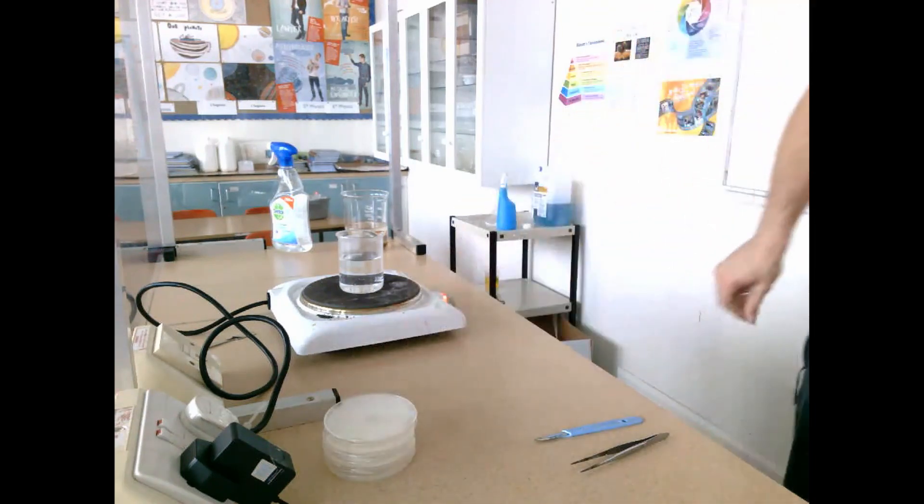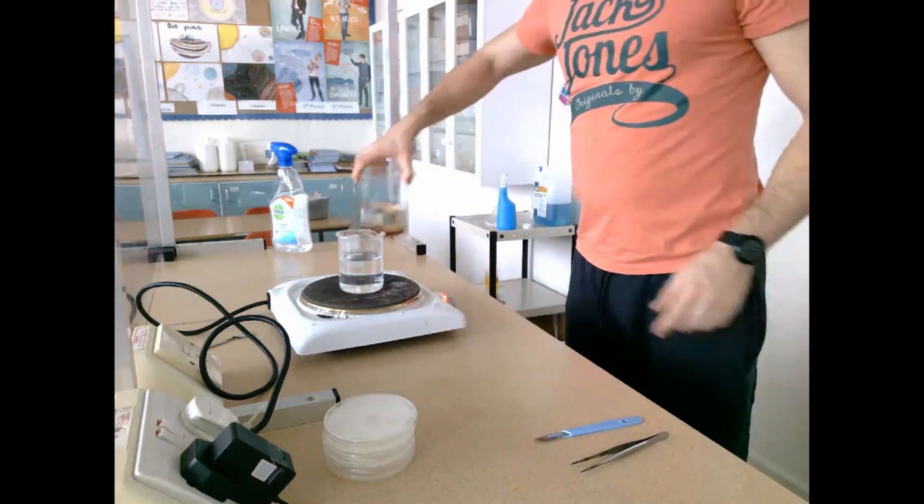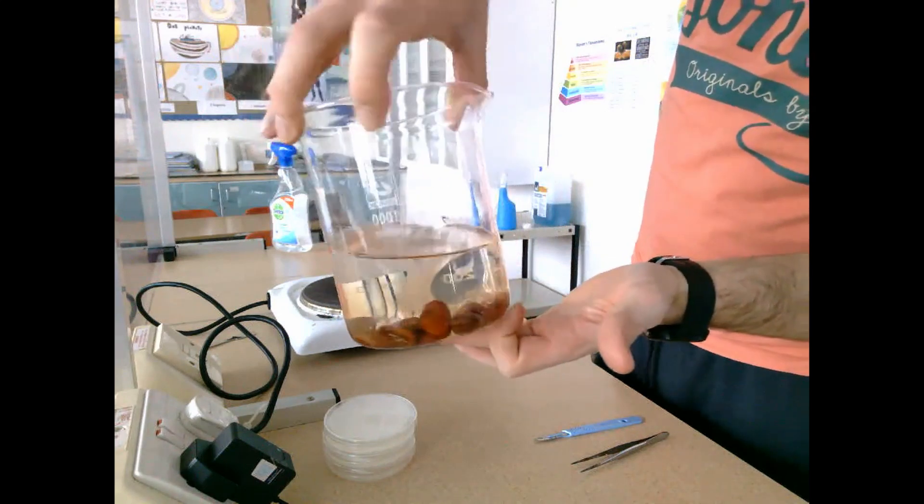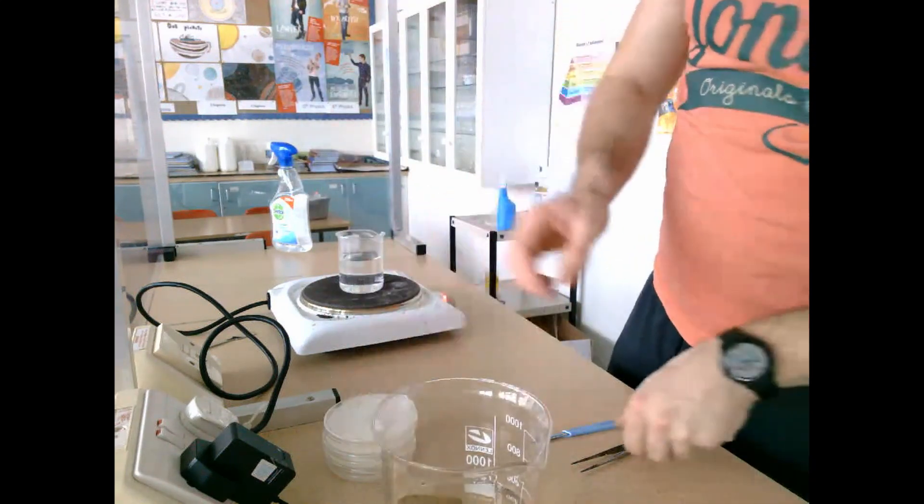The whole area is wiped down using disinfectant. The forceps and scalpel I plan to use are disinfected. I soon realize the scalpel is of no use, so I bring a knife in to disinfect that as well.